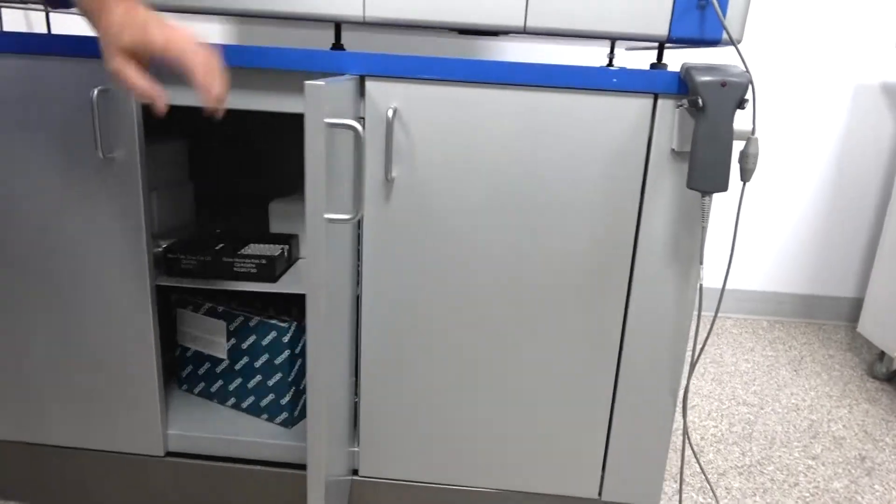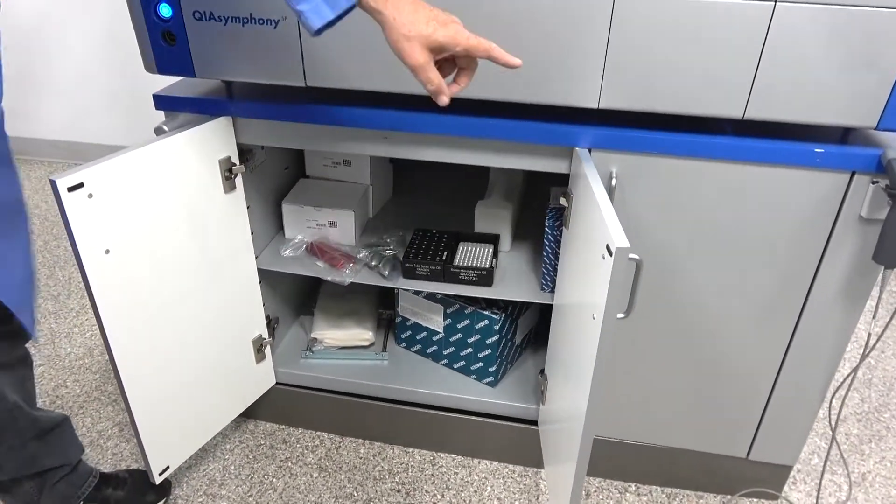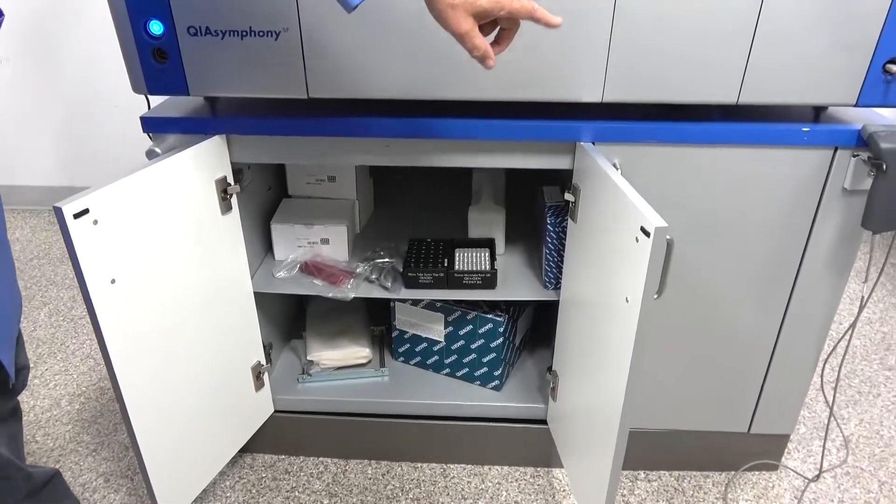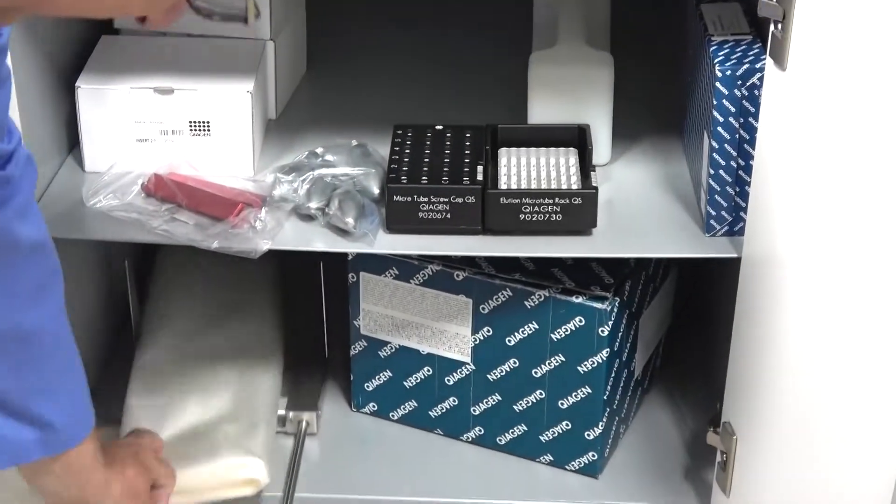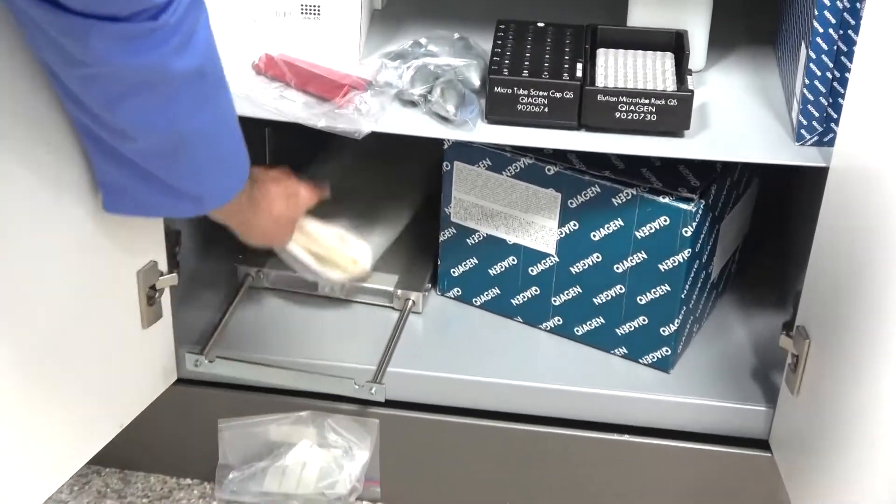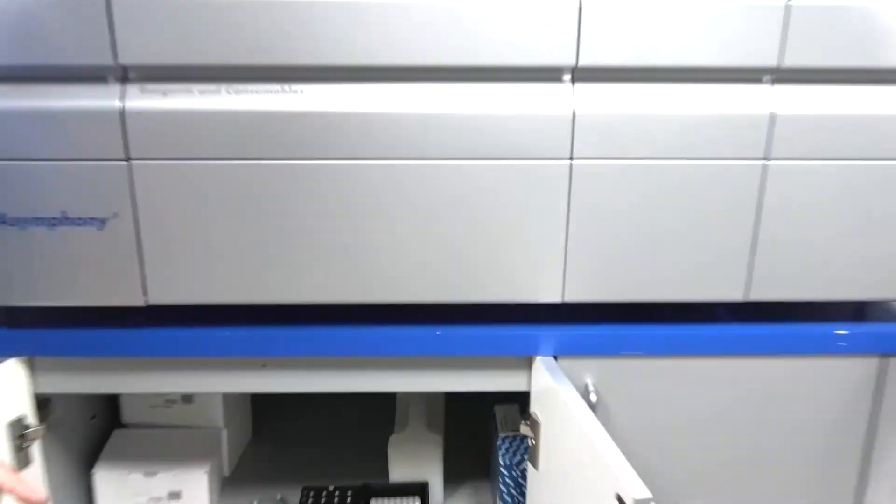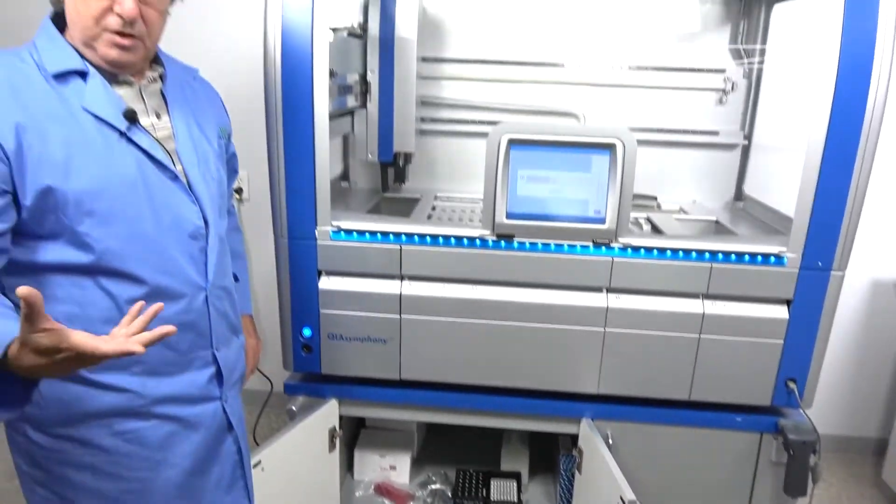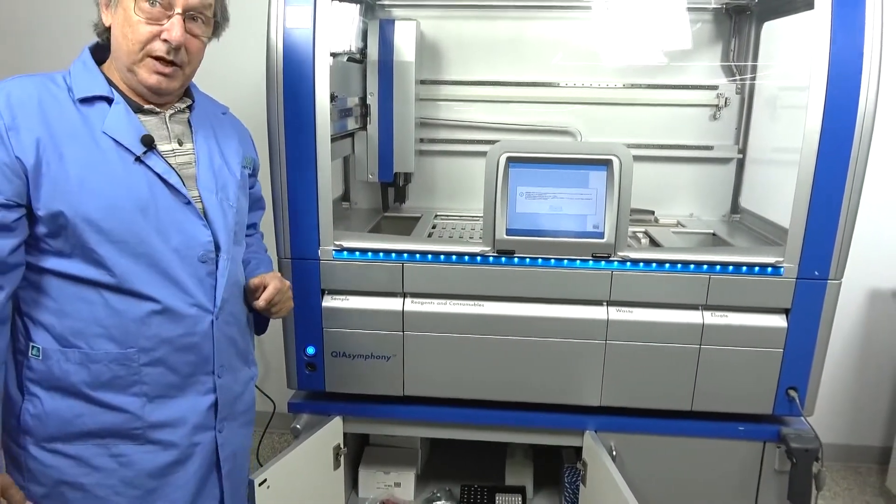Other thing, the cabinet offers a lot of storage. You are going to use a lot of different things. I talked about the waste bin there. If you don't use the cabinet, make sure that your unit comes with a rack that mounts under the waste drawer to catch the expired tips. If it doesn't, it's going to be mad at you.